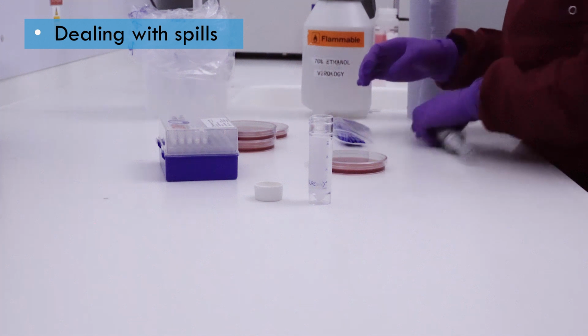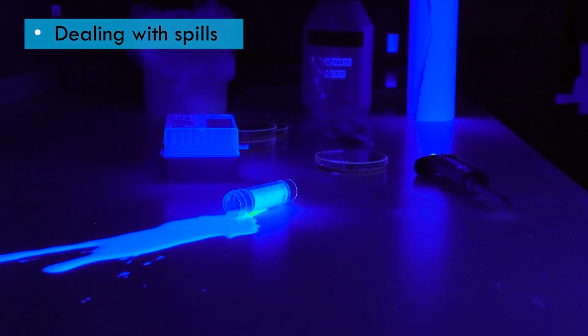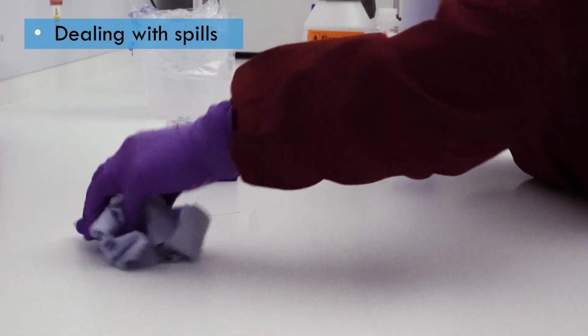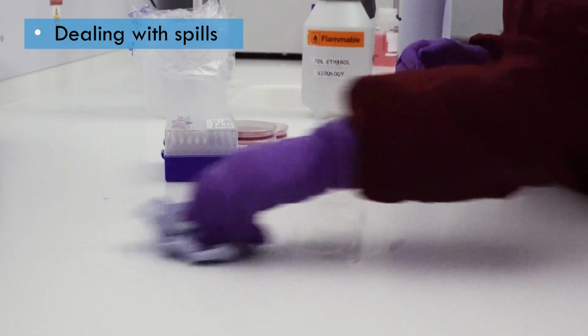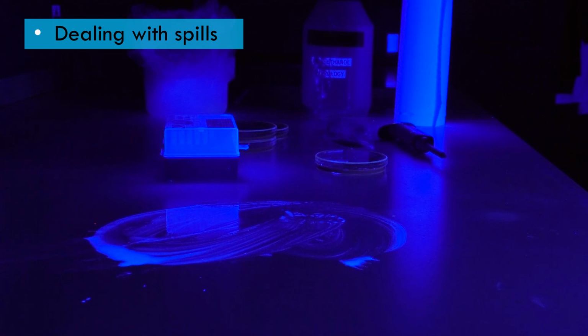It's important that people know how to clean up a spill safely and effectively. The initial mopping up must be done slowly and carefully, working inwards from the edges of the spill to avoid dispersing the liquid over a wider area. There will always be some contamination left on the surface, which will need to be cleaned using an appropriate disinfectant.